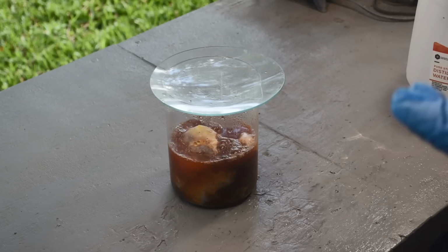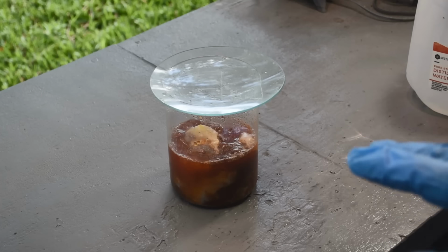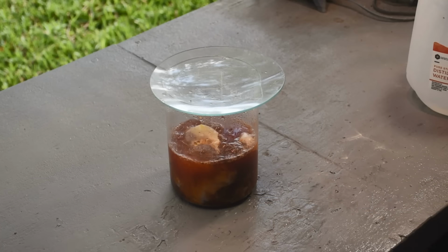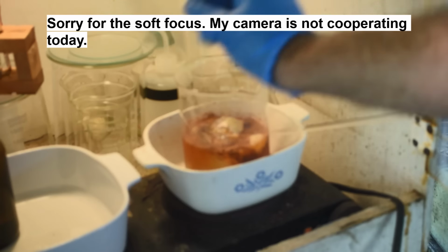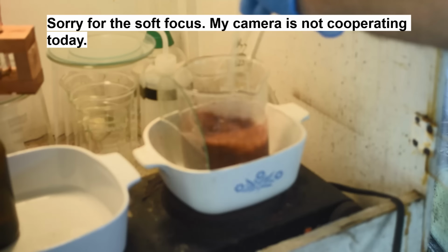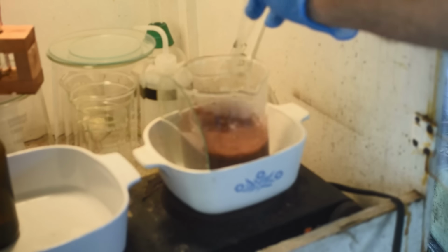But I'm going to help it along. I'm going to put it on some heat, low heat, and see if we can get all this stuff back into solution. Then I'm going to set up to filter it, and we'll filter out all of the solids. And then we will deal with getting our palladium back out of the solution. All right, I've got it in the fume hood. I'm going to put a little gentle heat to it, not too hot. And I'm going to stir it a few times. And we'll see if we can get all of this red salt back in solution.